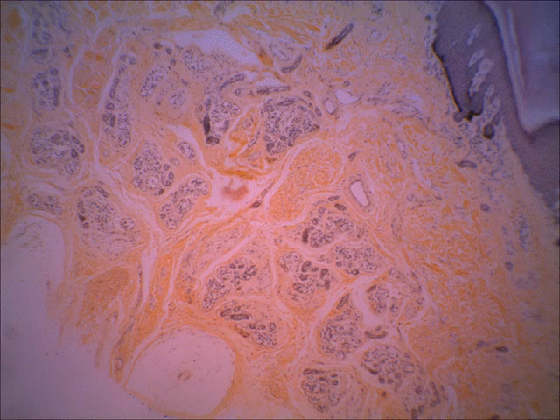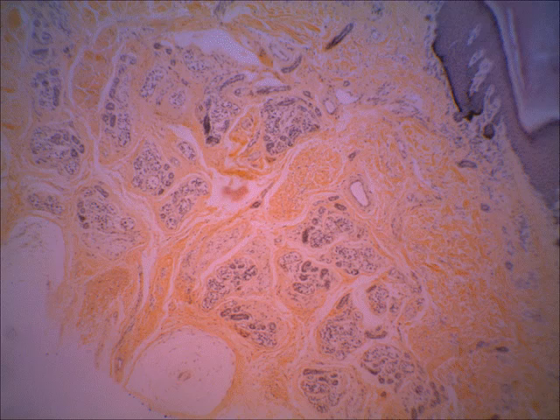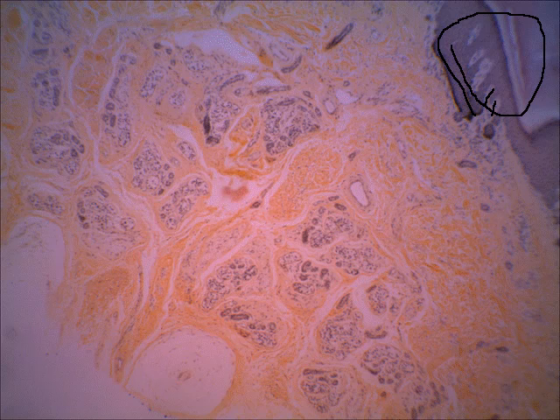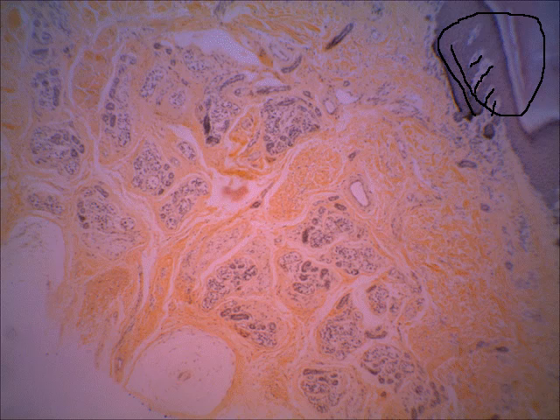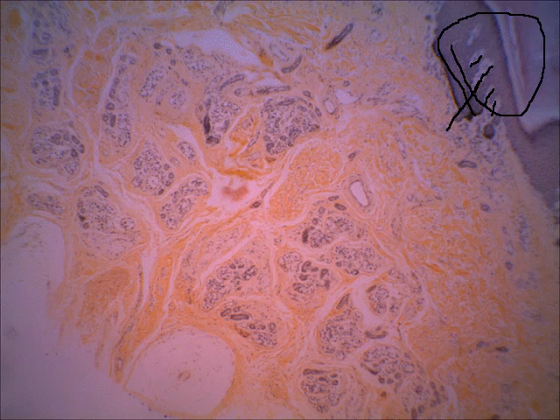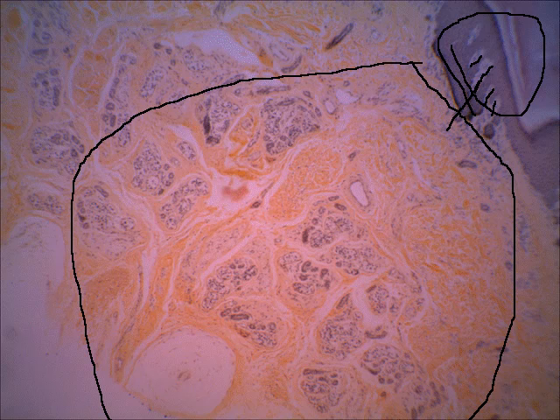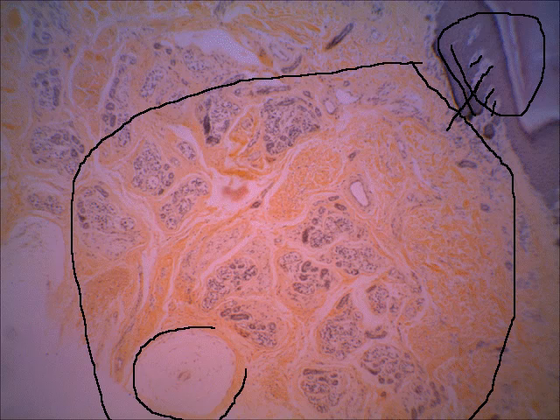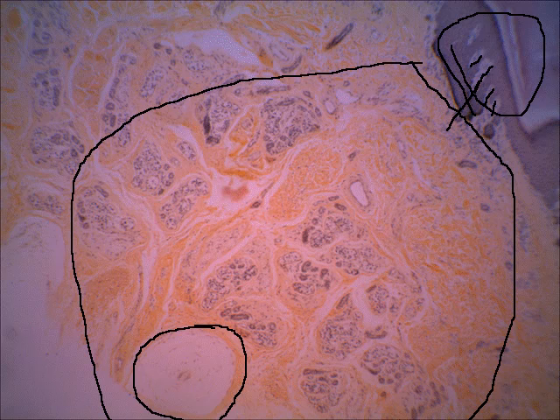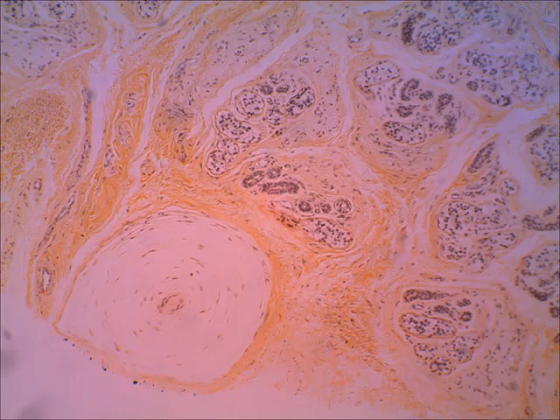This is still a skin slide — a different one. I can tell it's skin because at the top I see the epidermis, and I can see little portions of dermal papillae. This is sectioned kind of strangely, so you don't see the dermal papillae coming all the way down. But if you look down deep in the dermis, we're seeing another touch receptor. This is actually a pressure receptor called the pacinian corpuscle. It can be found deep in the skin, also in some deep internal organs. On the next slide, we'll see this on a higher view.